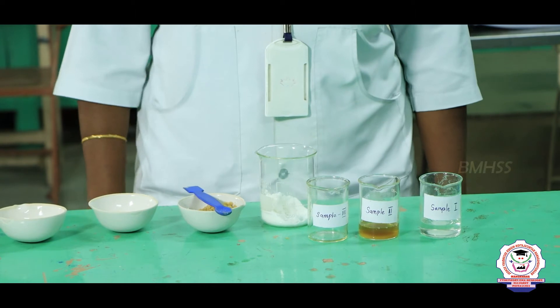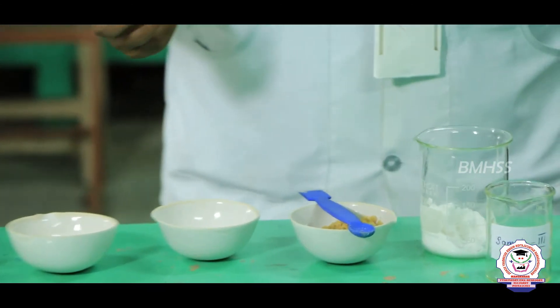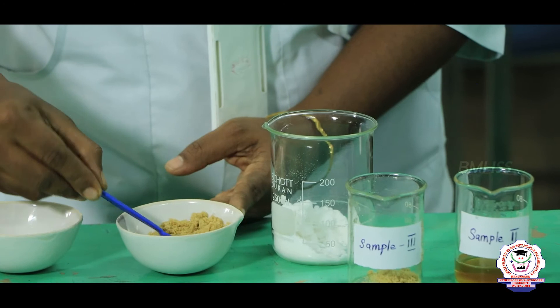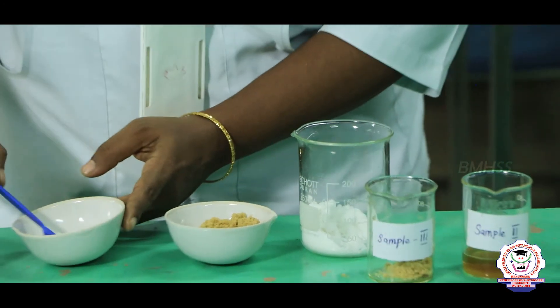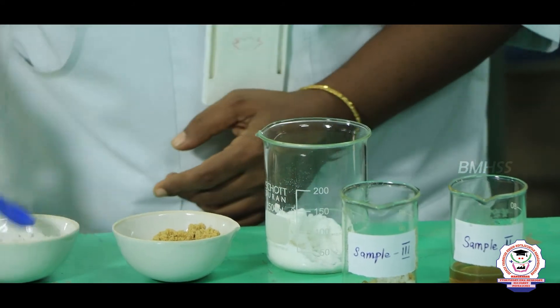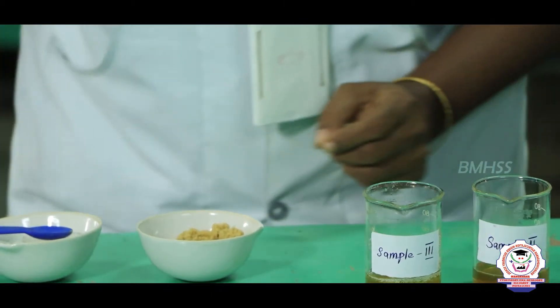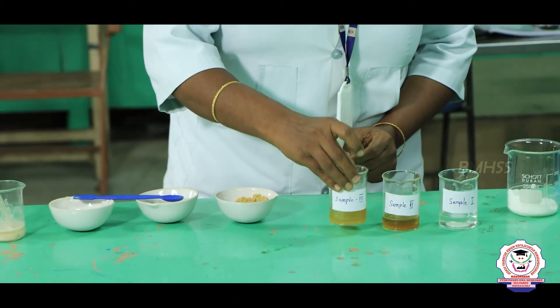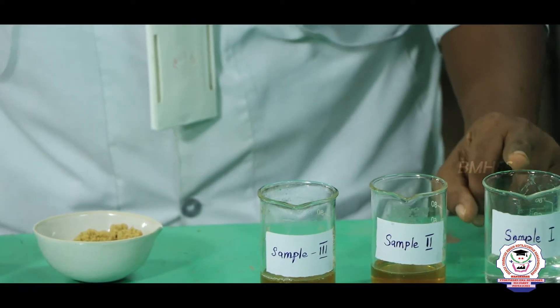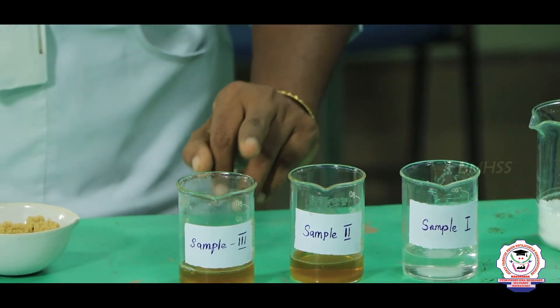Now we are going to make sample 3. In sample 3 we are going to use jaggery and salt — or we can use starch also. So we add jaggery and salt to make the sample 3 solution. Sample 3 is now ready. So: sample 1 contains glucose solution, sample 2 contains jaggery solution, and sample 3 contains jaggery and salt solution.